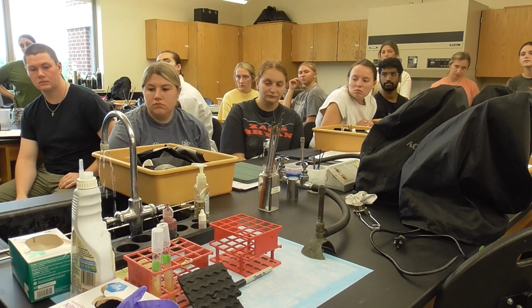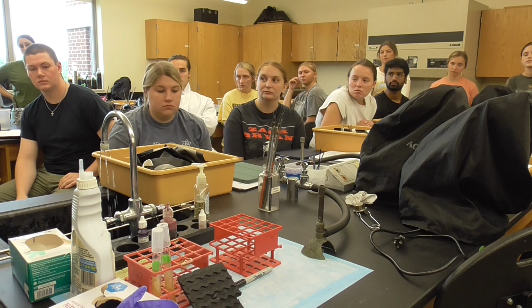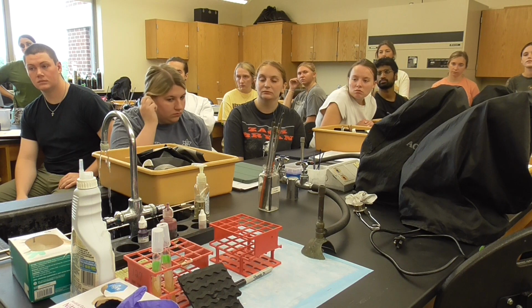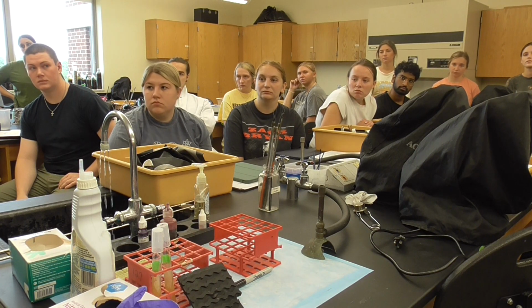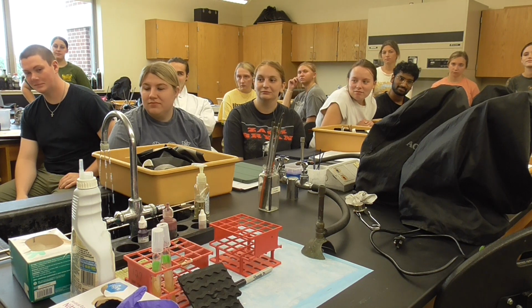So you're going to do the stain for about a minute. And at this moment, you can do the timer. You can count the Mississippi, whatever is comfortable for you. Approximately 1 minute is good.